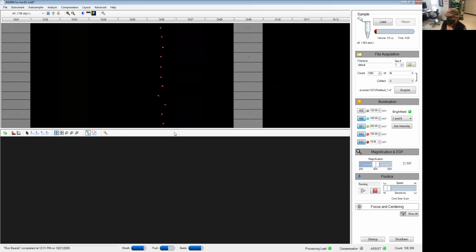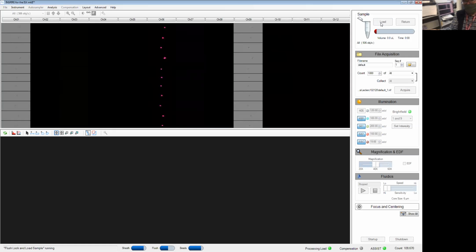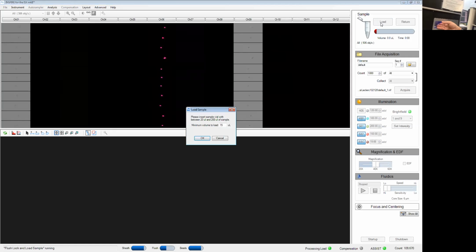To load your sample, simply press the load button. It will bring down the loader or the portal at the front of the instrument, which we're going to see here. Everything takes a bit more time on this machine. There you go. Then I can simply put my tube in place and move on.